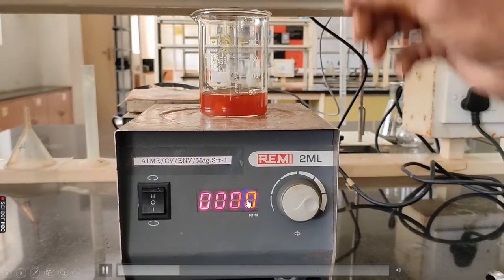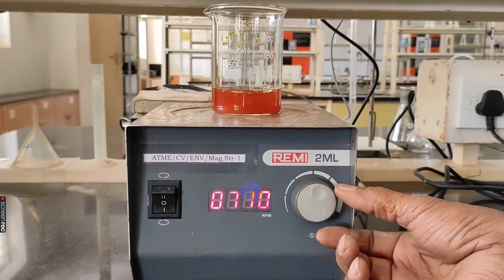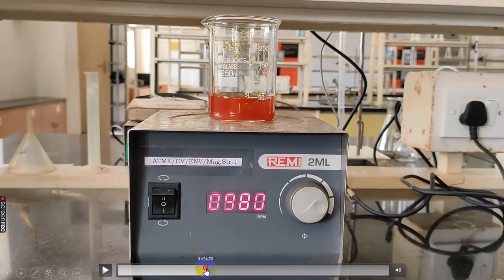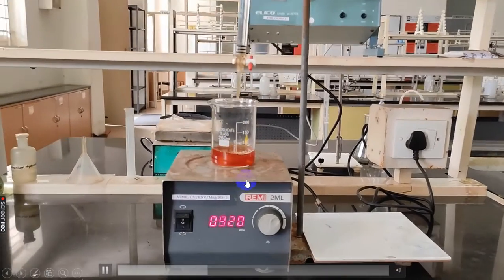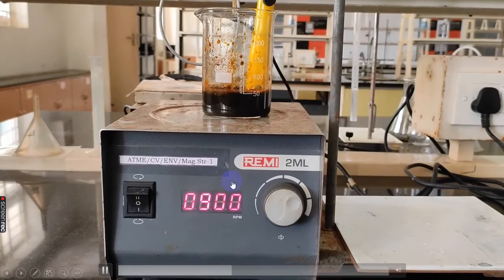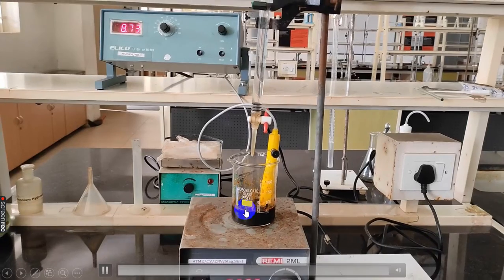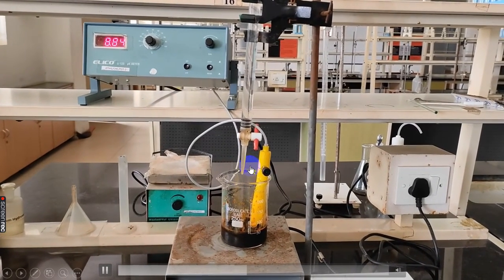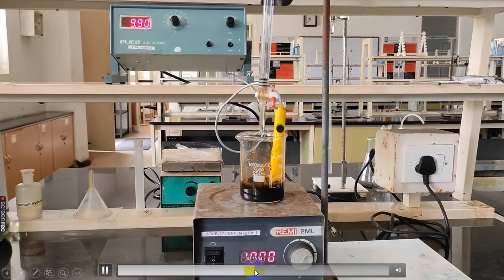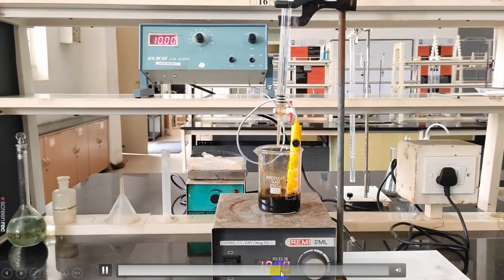It is placed in a magnetic stirrer and the RPM level is adjusted to up to 1000 RPM. With constant stirring, ammonia of 3 molar is added dropwise till the pH level reaches 10. You can see the black precipitate is obtained and we keep on adding ammonia dropwise till the pH range is about 10. You can see the pH now is 10.